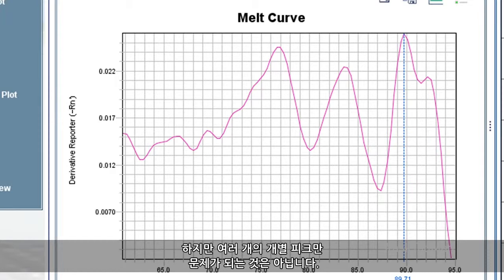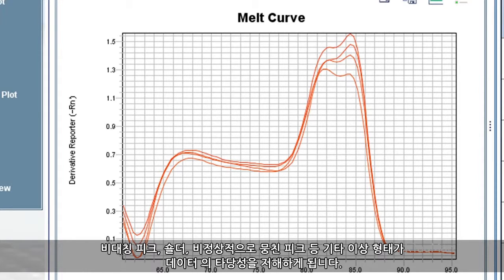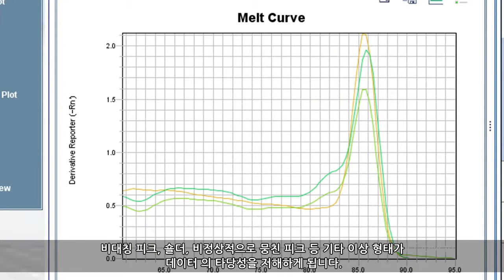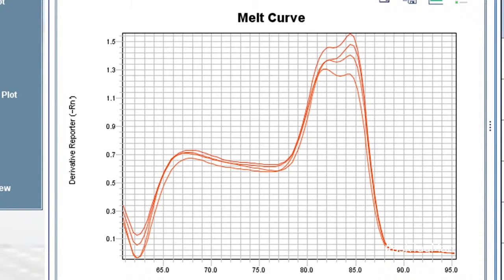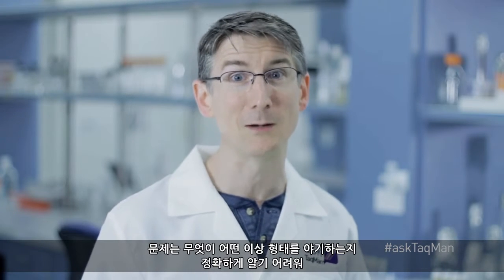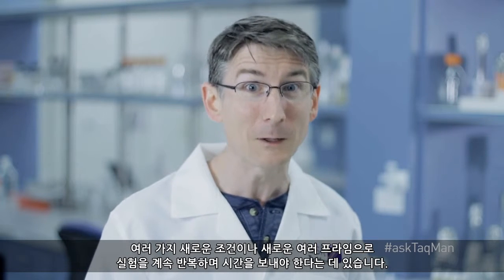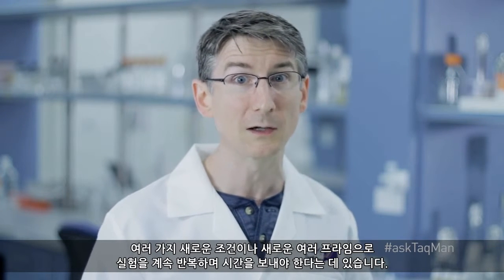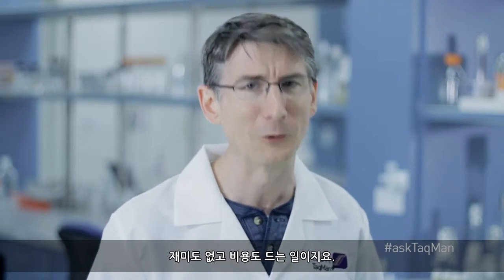But multiple discrete peaks are not the only thing that should concern you. Other anomalies such as asymmetrical peaks, shoulders, and unusually chunky peaks should make the user question the validity of his or her data. The problem is, it's difficult to know exactly what's causing certain anomalies. So some users end up spending a lot of time repeating failed experiments under multiple new conditions or with multiple new primer sets. That's neither fun nor affordable.